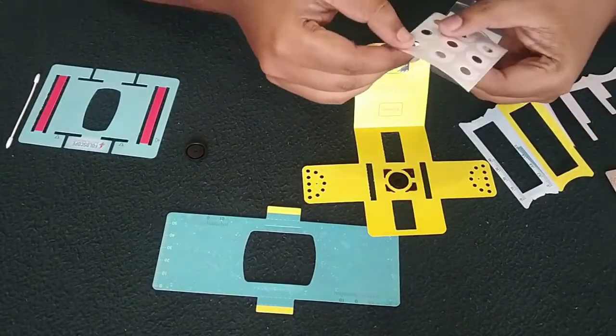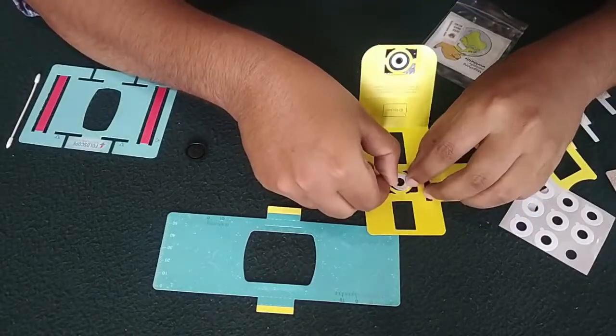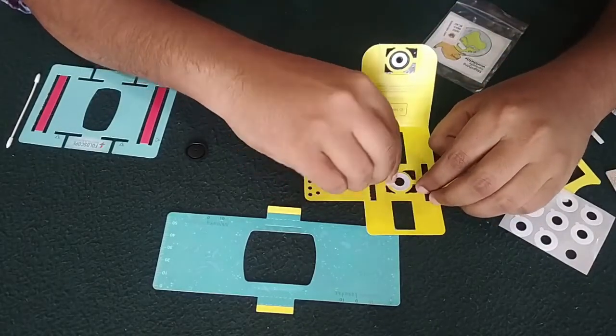Now taking one of these stickers, place it exactly on this coupler ring.